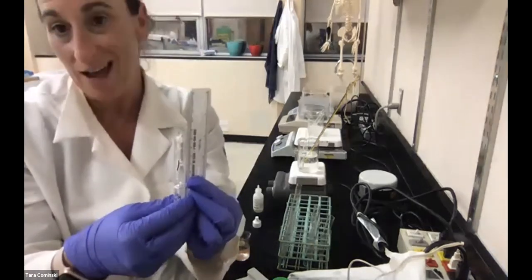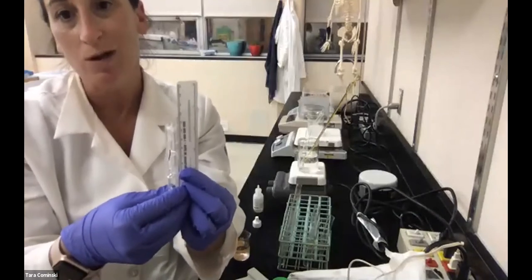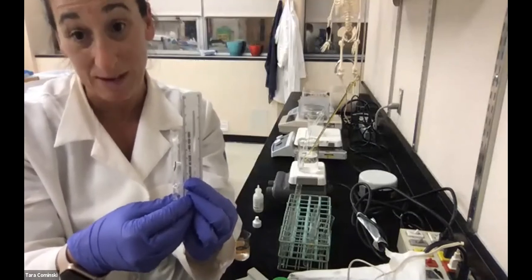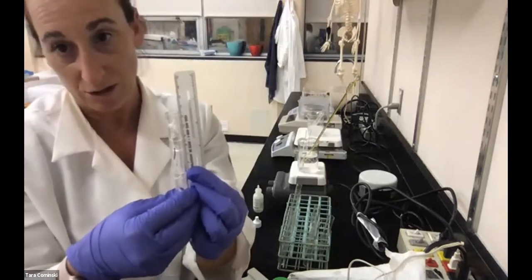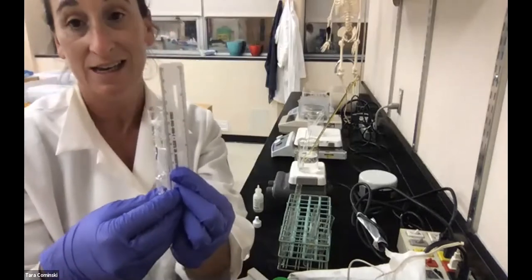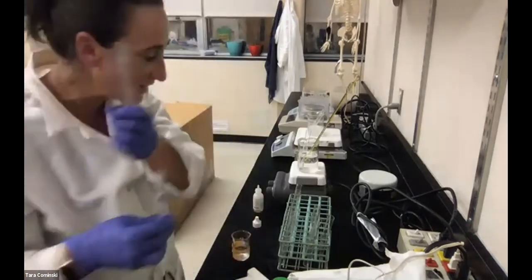So let's do some conversions here. You convert your 11 centimeters into millimeters. Easy, just add a 0. So 110 millimeters, or 11 centimeters, but let's keep everything in millimeters. If I tell you something in centimeters, you're going to have to be able to convert it. So we're going to call it 110 millimeters. Sound good? That's for tube 1.